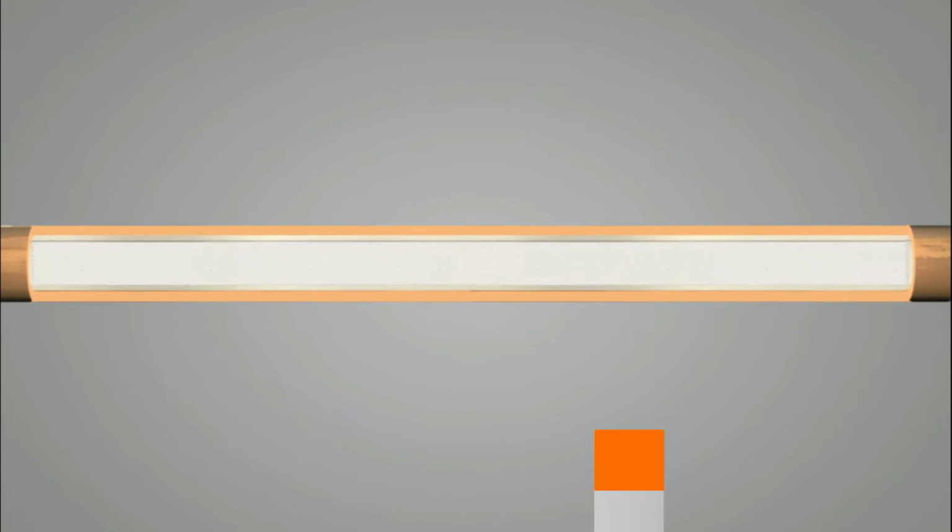It will get mixed with hydrogen because it needs to flow within the detector. So air and hydrogen will help this. Another function of air is ignition. So the sample will come through this direction, and the igniter will inflame this. So the sample will be destructed or inflamed by the flame igniter.